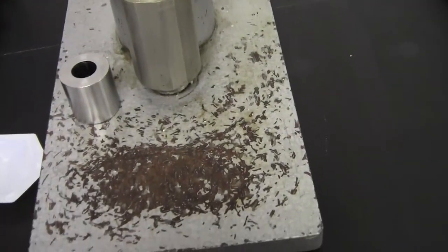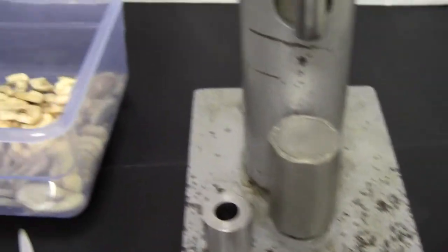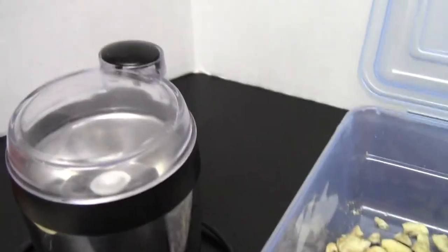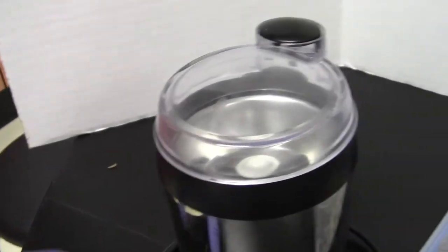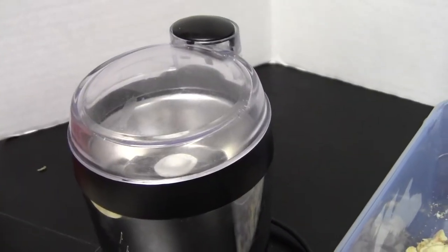And if that press gets dirty, you need to wipe it out with a Kim wipe. Make sure that's nice and clean and dry. And please unplug before you reach in and clean or remove the contents of this.